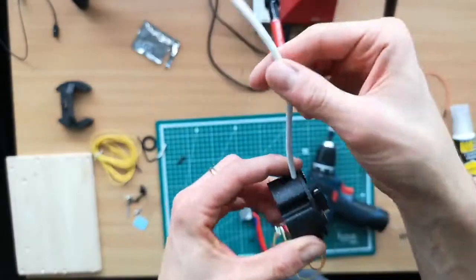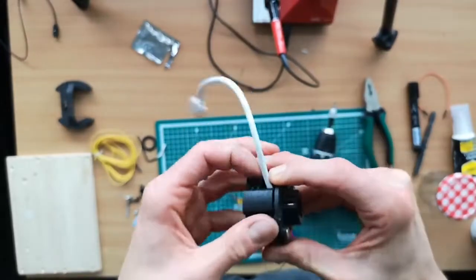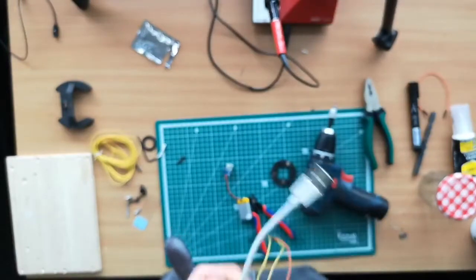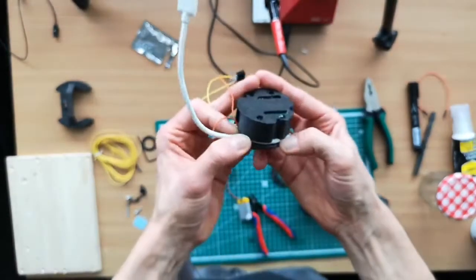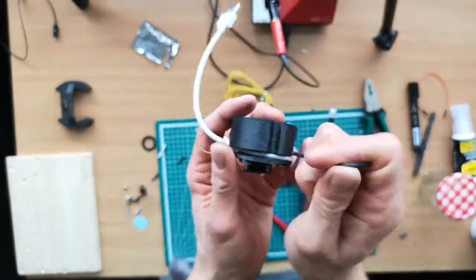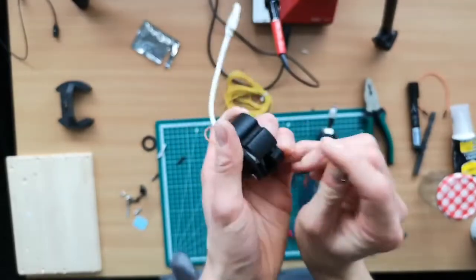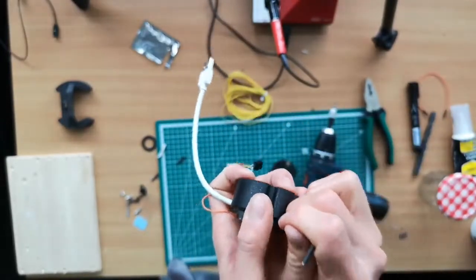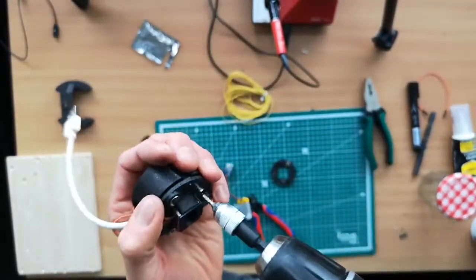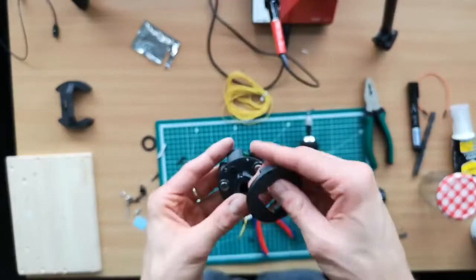One thing I found out is that this cable is better to come out of this direction. So we just open it again quickly and make sure the wire is going the other way. Once everything is snapped in again, we can continue. There we go. So now we can use this mechanism.